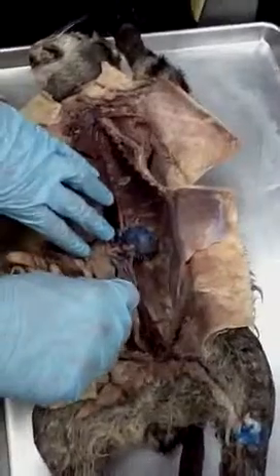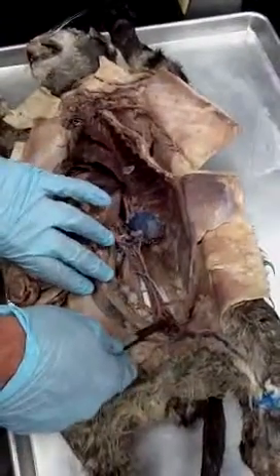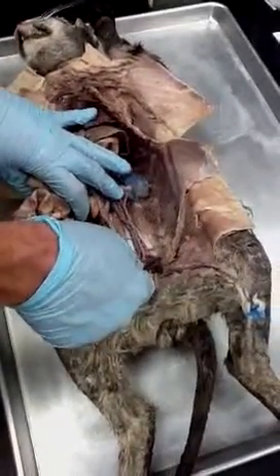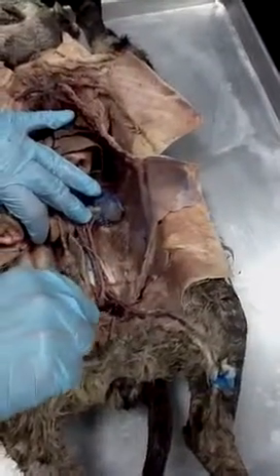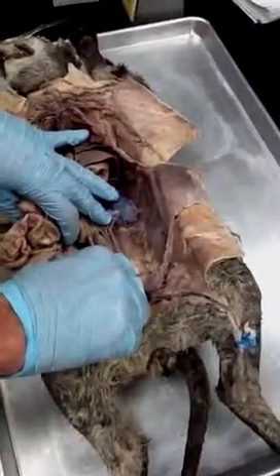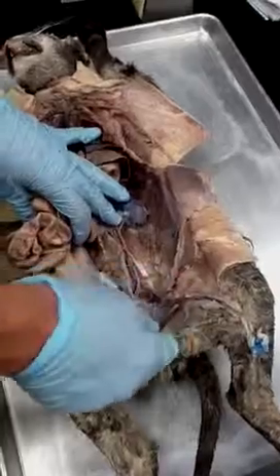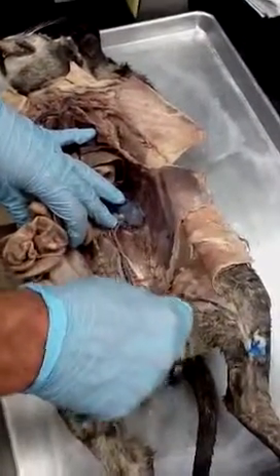and then the abdominal aorta keeps going down, and then at the split, we've got the external iliac artery, and then the split down here is the internal iliac. So external, internal iliac, and then once that iliac artery gets up into the leg, after that branch, it'll be the femoral artery.